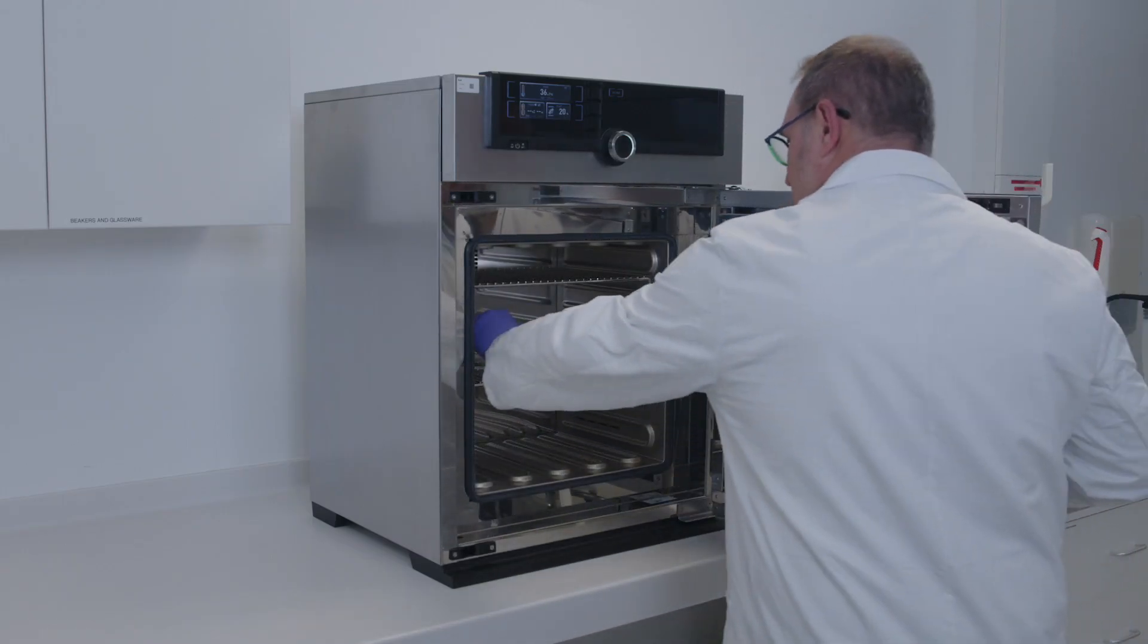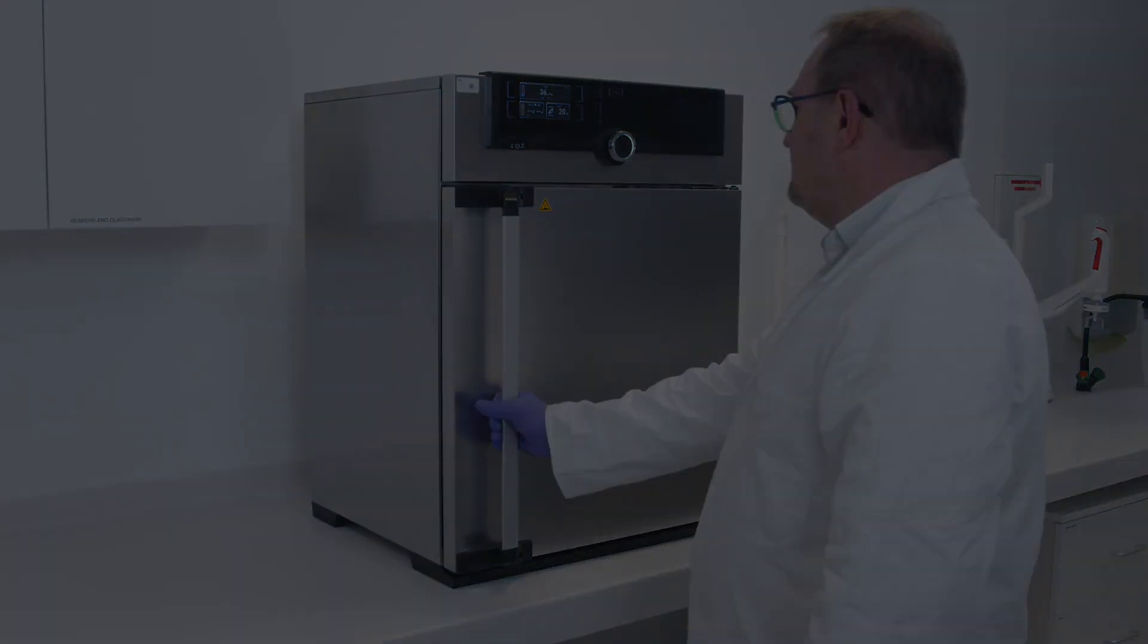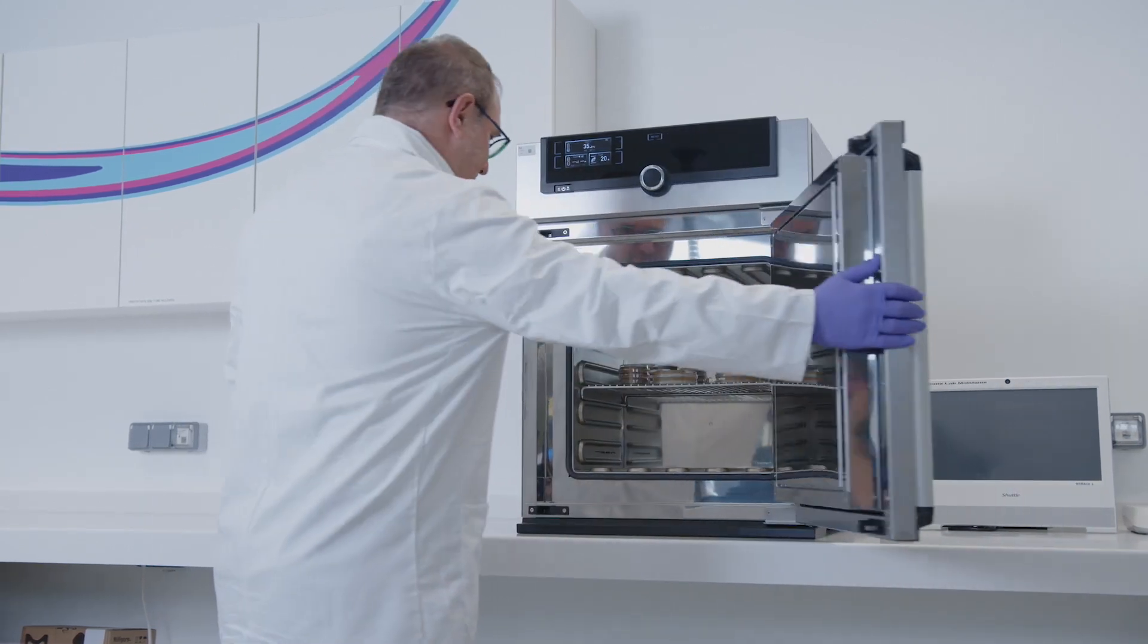Incubate the plate according to the guideline. Take the plate out of the incubator and count the colonies.